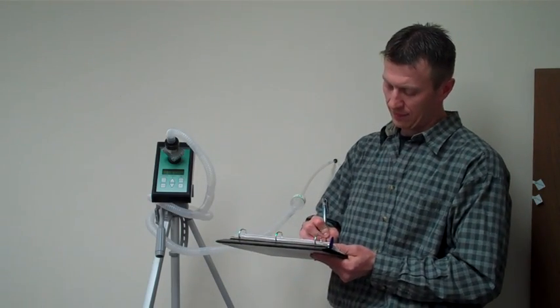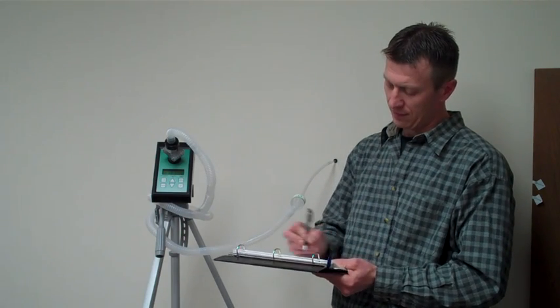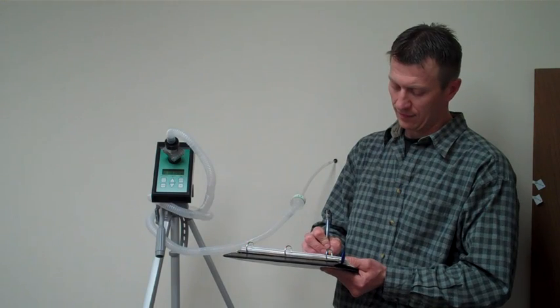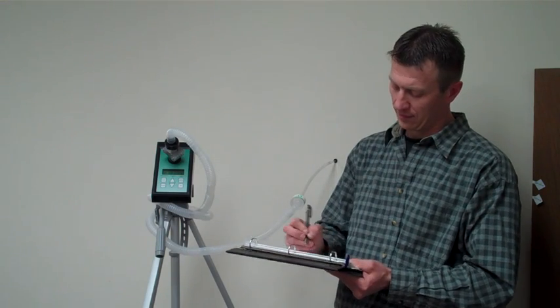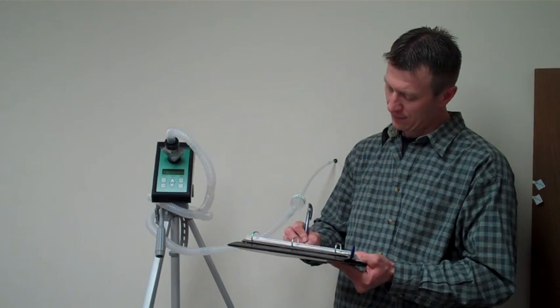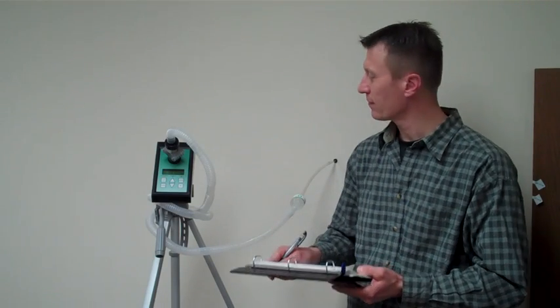The cell will then be sent to a laboratory where it will be analyzed by a mycologist. They will be identifying what types of mold spores were within the cavity as well as the quantities. This information will then be used to determine the likelihood of a mold source within the wall cavity.